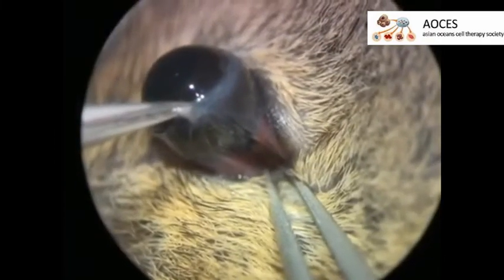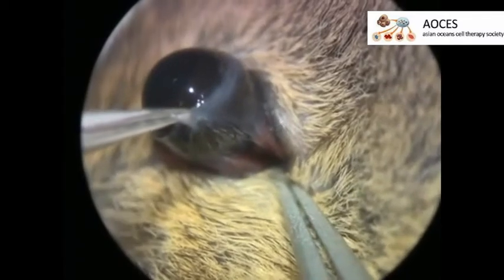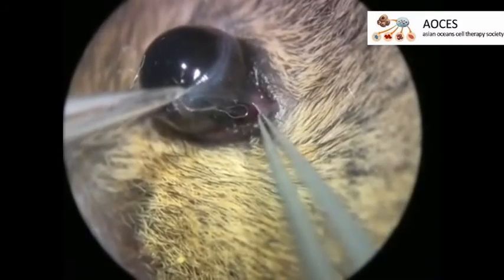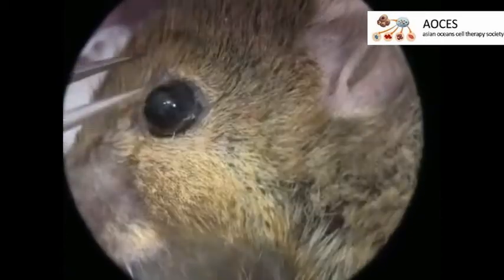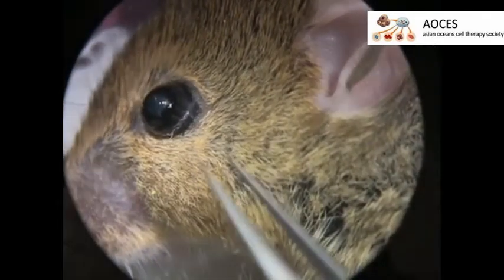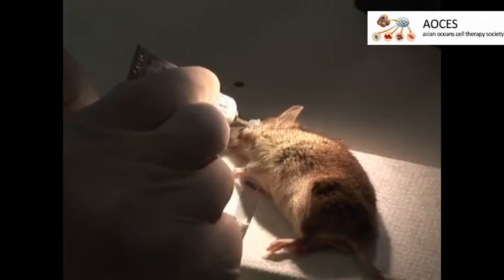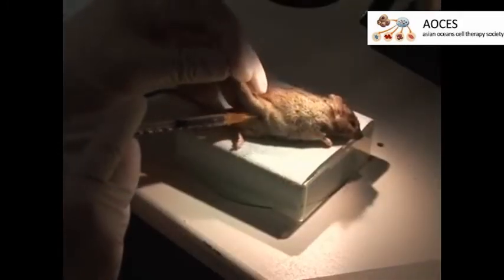Then, using cross-action forceps, crush the optic nerve at a distance of 2 mm from the eyeball, applying pressure for 3 seconds. After completion of the crush injury, cover the optic nerve with the displaced tissues and conjunctiva and suture using 10-0 sized silk suture material. After suturing and before the mouse recovers from anesthesia, apply some antibiotic ophthalmic ointment to the eyes and administer an injection of buprenorphine for analgesia.